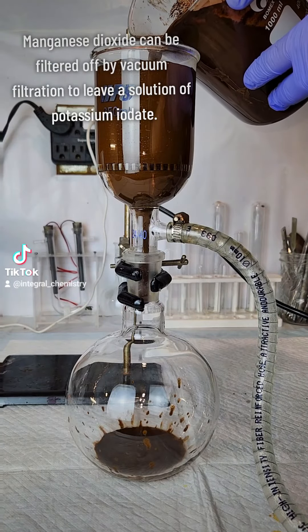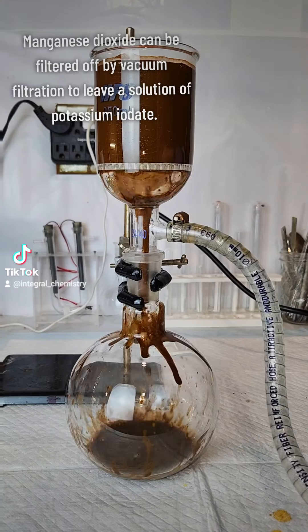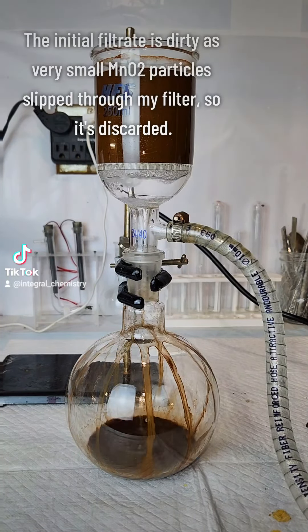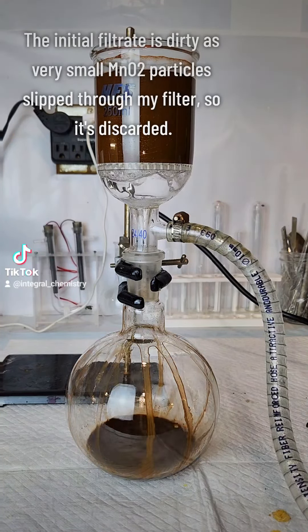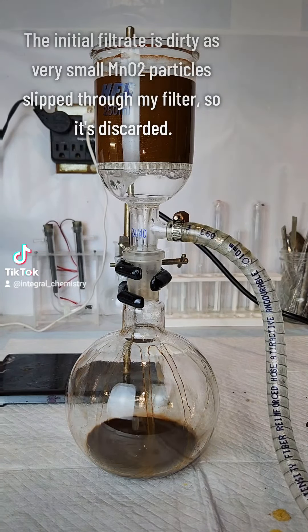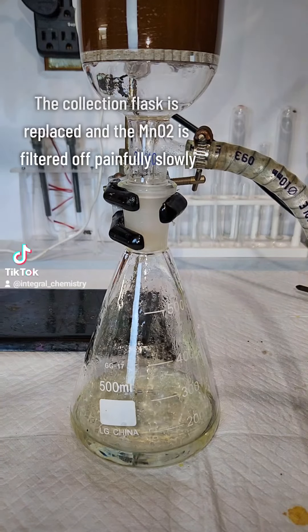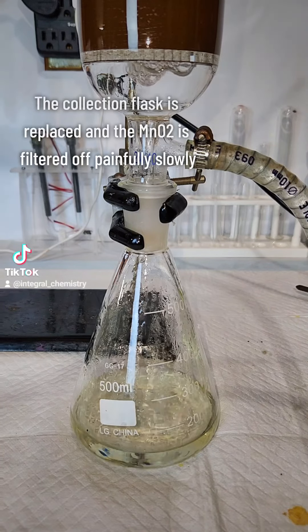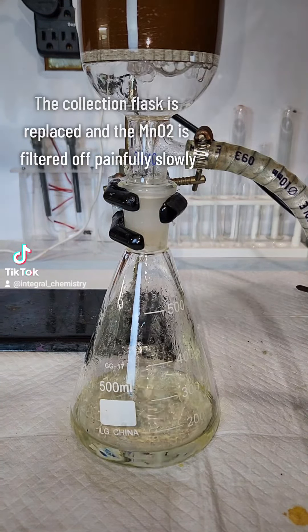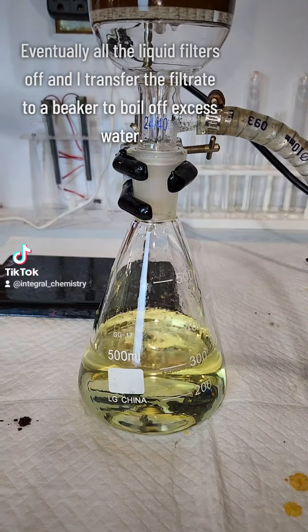The next big problem was trying to separate the insoluble manganese dioxide from the potassium iodate which was still dissolved in the water. This step sucked, and it's probably impossible without vacuum filtration because manganese dioxide precipitated in this manner forms very very small particles that make the mixture very muddy and almost clay-like.